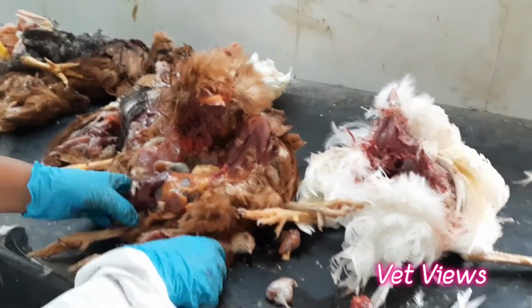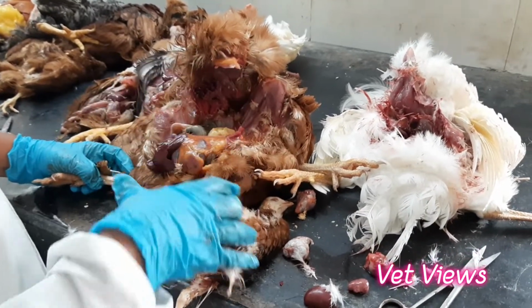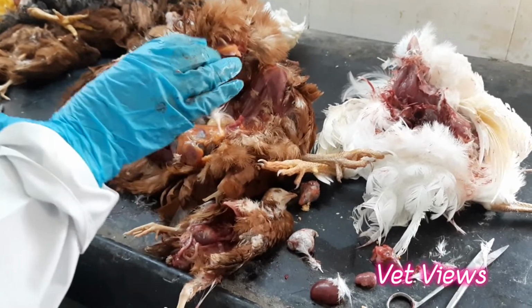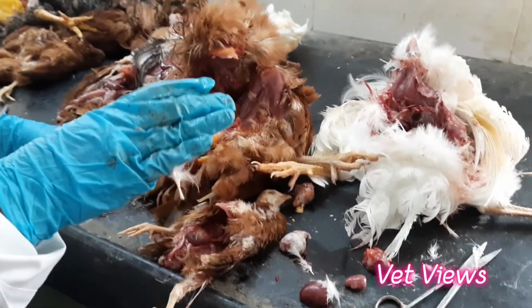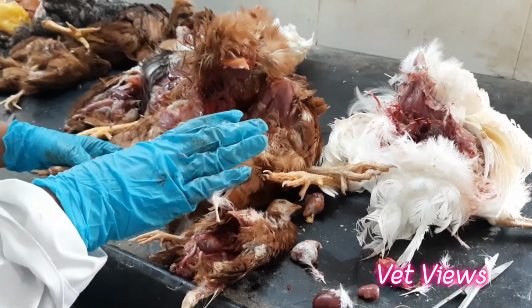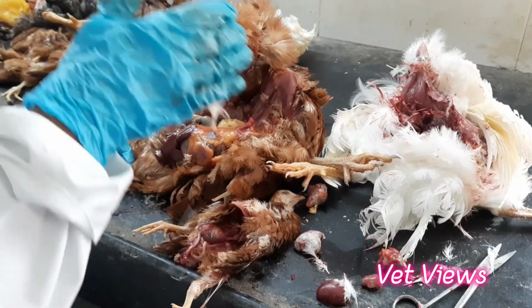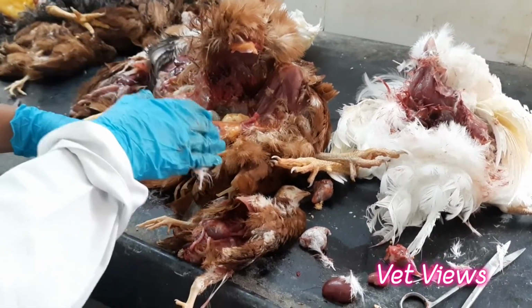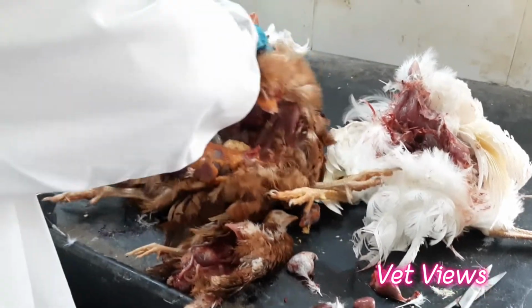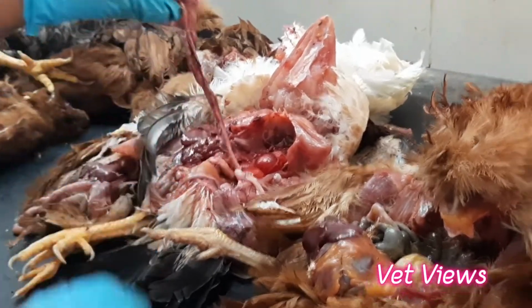Then coming to the other organs. You have seen the heart and the intestinal part, so now the reproductive organs. In infectious bronchitis, a coronavirus infection of birds, we will find 3 variants. One is the respiratory form of the disease, wherein only the lung and trachea are affected. In another form, the oviducts are affected. The oviduct, what I was showing now, sometimes becomes completely filled with fluid. A lot of fluid accumulation will be there in the oviduct.